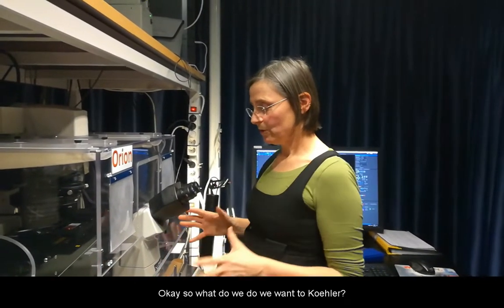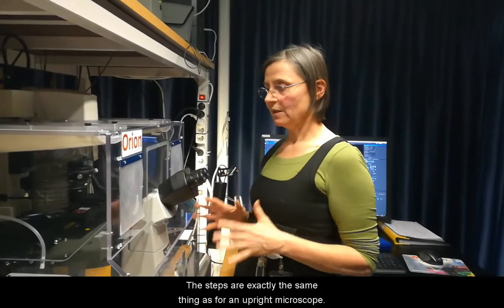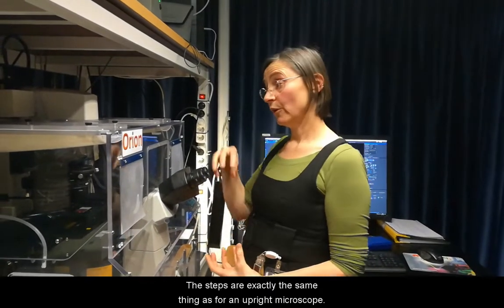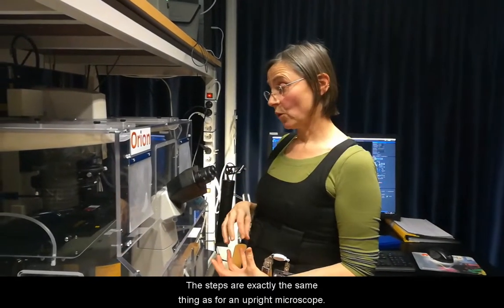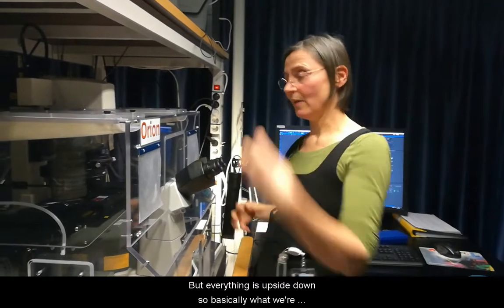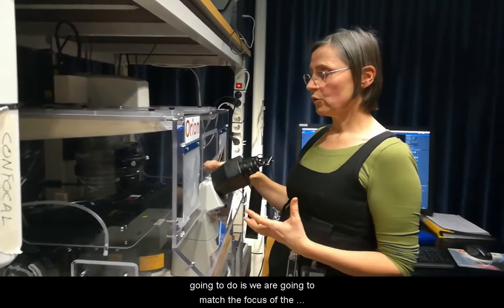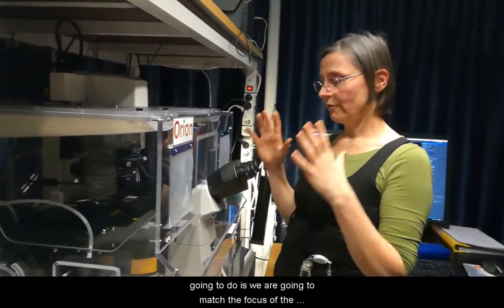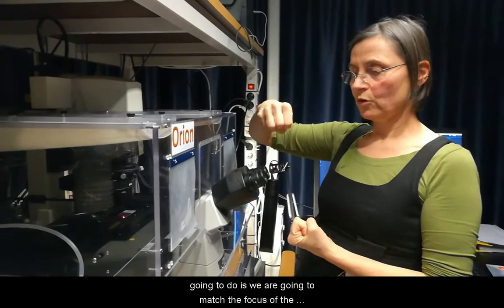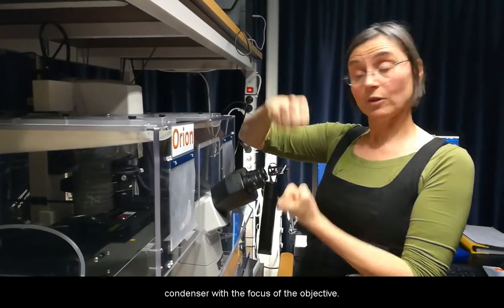So what do we do when we want to do Köhler illumination? The steps are exactly the same as for an upright microscope, but everything is upside down. Basically what we're going to do is match the focus of the condenser with the focus of the objective.